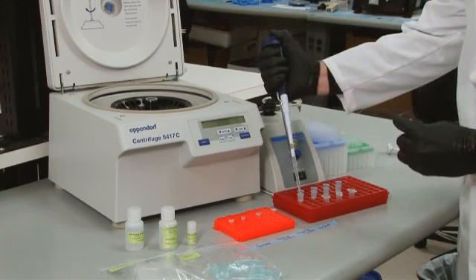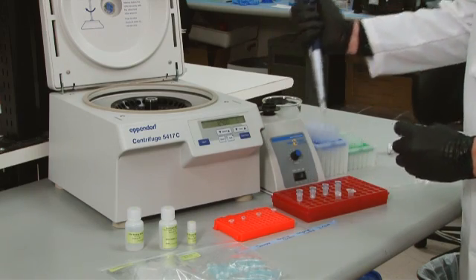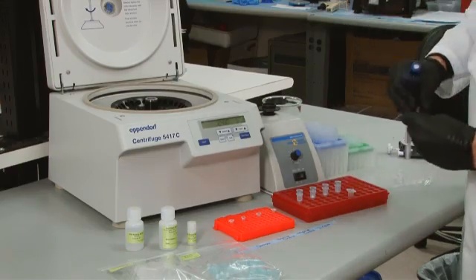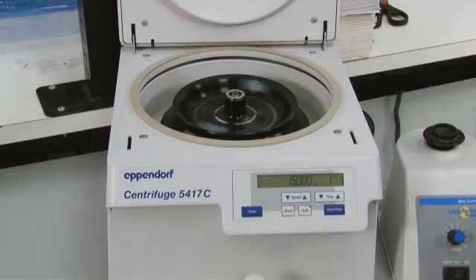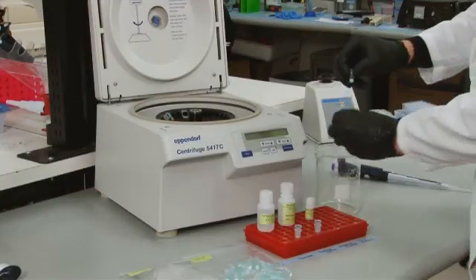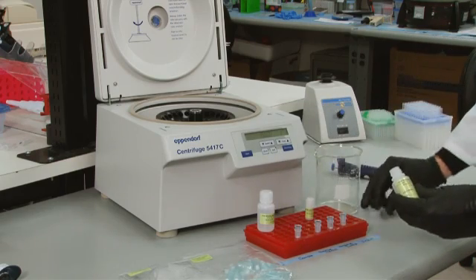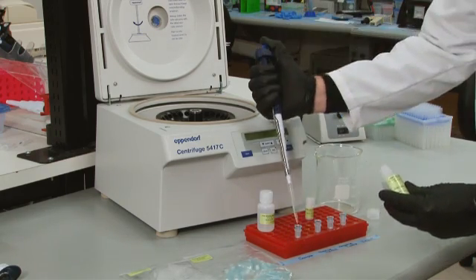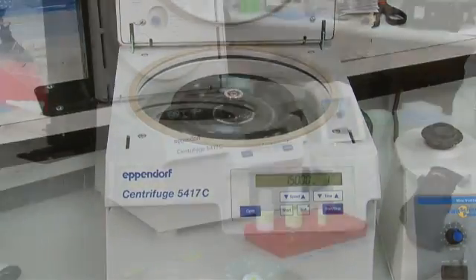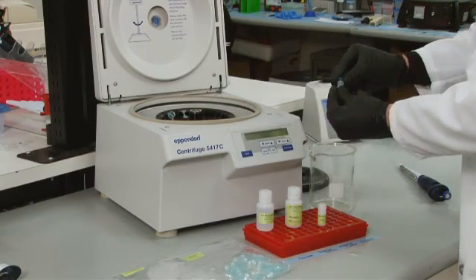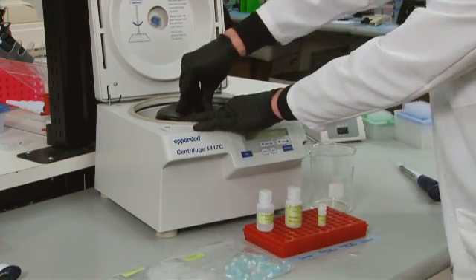To purify each sample, we will use a DNA binding silica column according to the manufacturer's instructions. First, add each sample to the proper amount of DNA binding buffer and vortex. Then, transfer each sample to a column placed inside a collection tube. Centrifuge the columns at 15,000 G for 1 minute. Discard the flow-through from the collection tube.